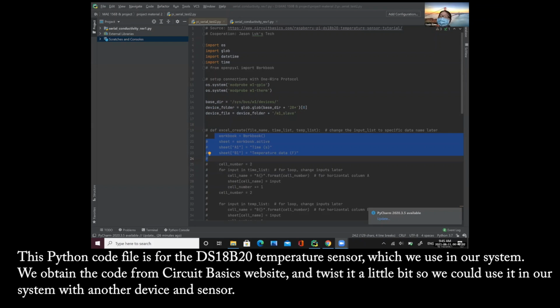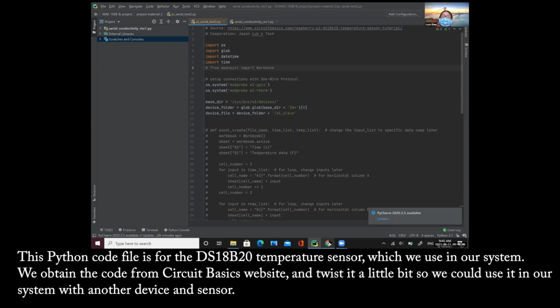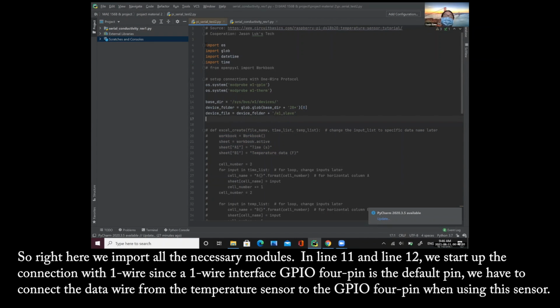This Python code file is for the DS18B20 temperature sensor used in our system. We obtained the code from Circuit Basics website and twisted it a little bit so we could use it in our system with other devices and sensors, and also use it individually. We add the code block to allow temperature data and the time data to export into an Excel file. So right here, we import all the necessary modules.